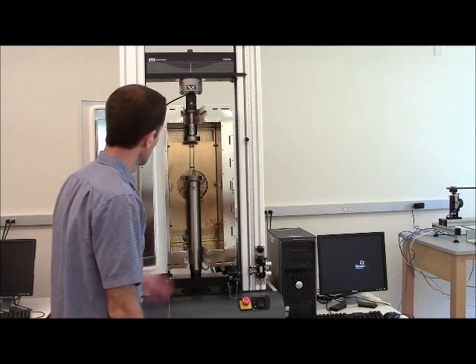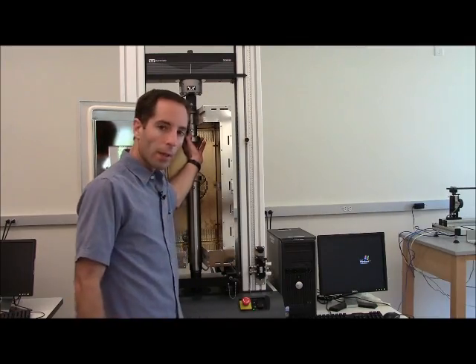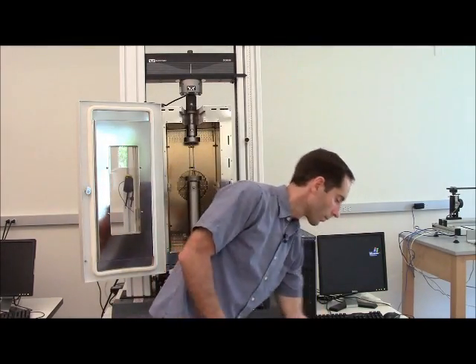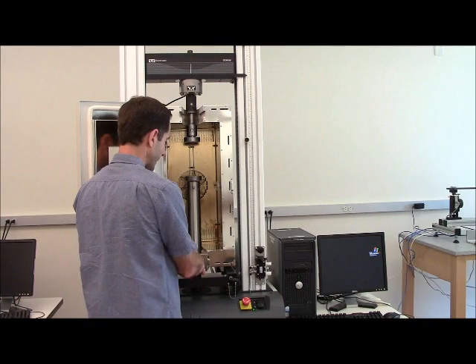With both compression platens in place I can now place the wedge grips back in. I notice up at the top though I have a slight clearance issue so I'm going to bring the crossmember down to make sure that everything's cleared out in order to get the wedges back in. I've got enough clearance now up the top so I'll put the wedges in. Make sure that the stainless steel side is towards the oven or inside the oven.